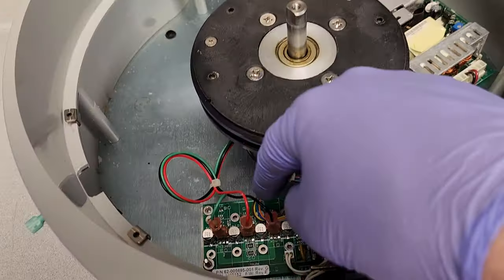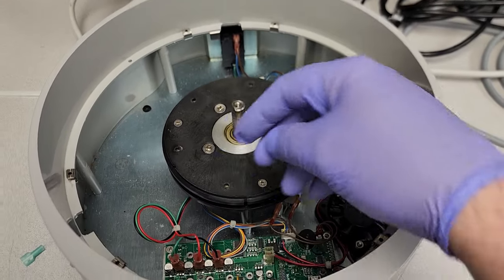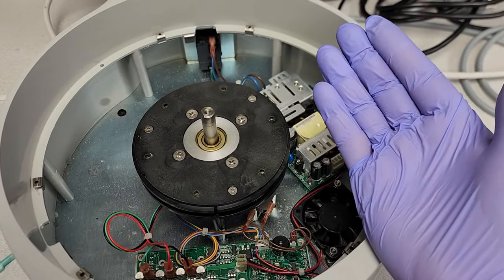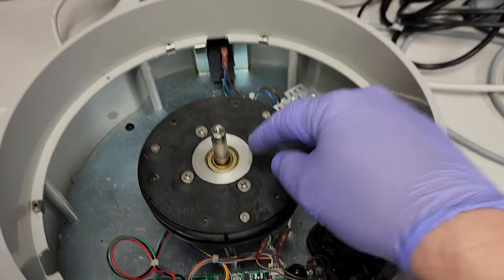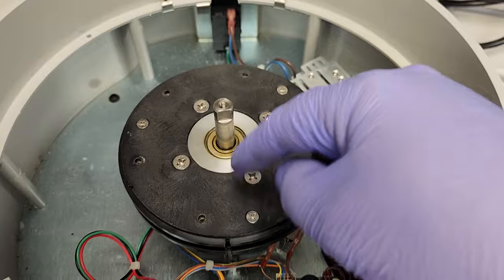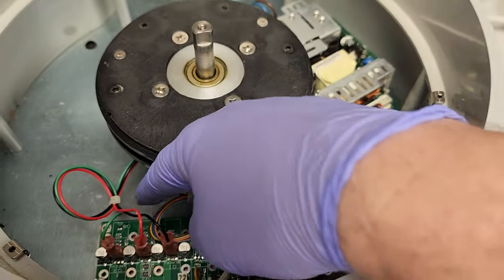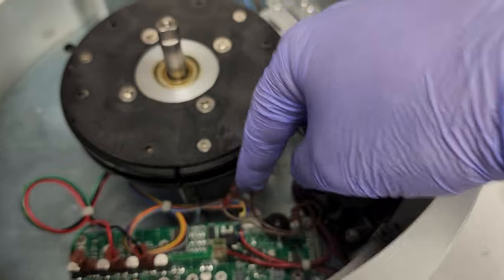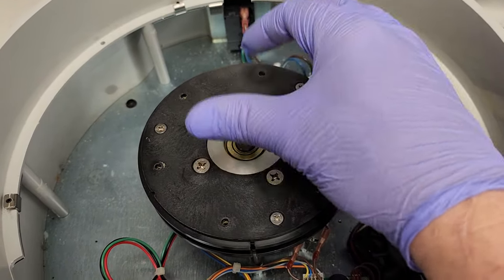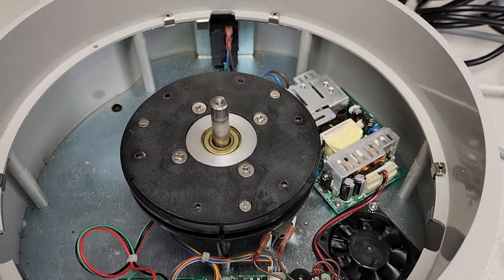That is the reason. You need all three connections for that motor to spin, because it's changing the magnetic field between the coils — and you're only able to activate one of the three coils with just two wires connected. It's sending pulses to the coil and expecting a return. This cable here goes to the motor speed sensor, which should be a hall effect sensor below, and it gives feedback back to the board. All three-phase motors need some sort of feedback — either through back-EMF through the three channels, or through a hall effect sensor. It's not sensing that it's spinning, so it gives the error code saying the motor can't maintain its speed.